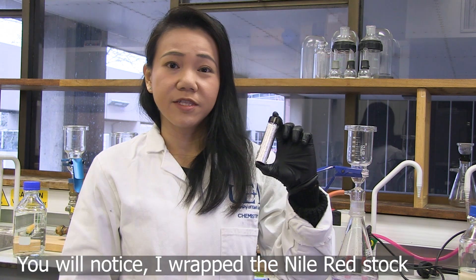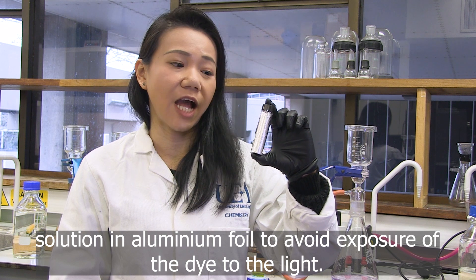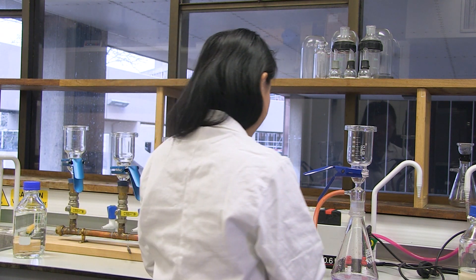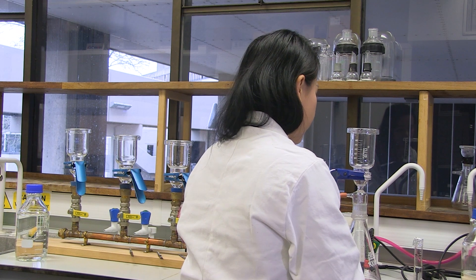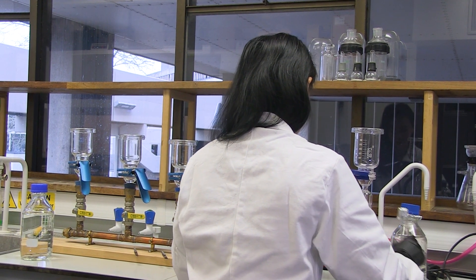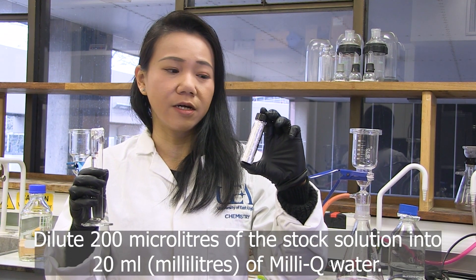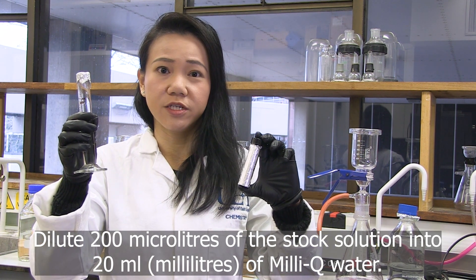You will notice I have wrapped the Nile red stock solution in aluminium foil to avoid exposure of the dye to light. Dilute 200 microlitres of the stock solution into 20 ml of Milli-Q water.